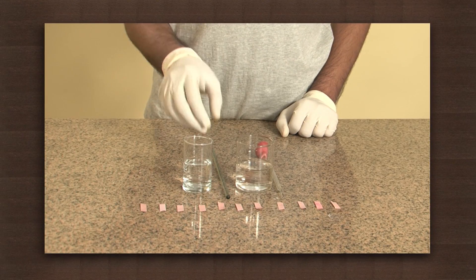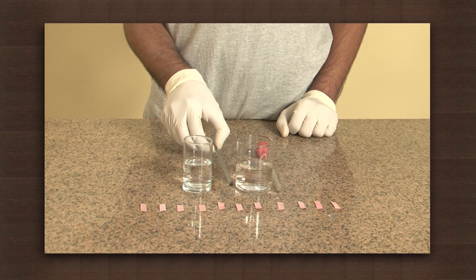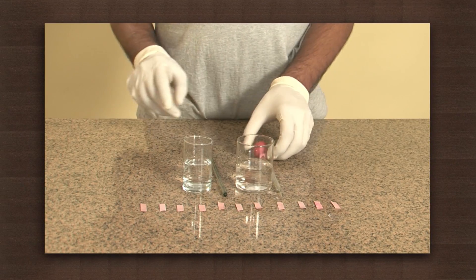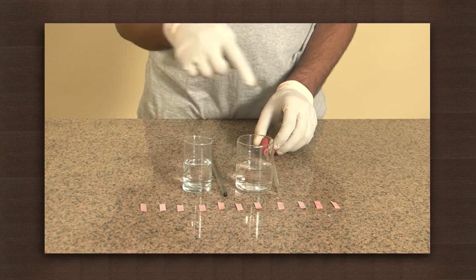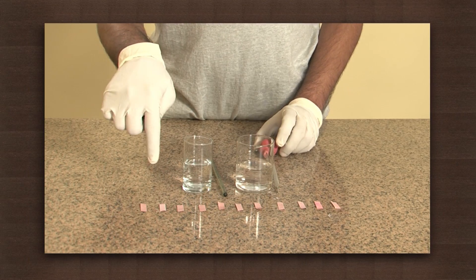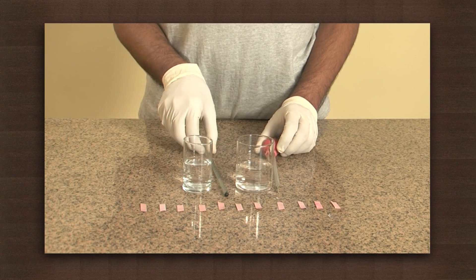Let us try an experiment to see what happens when an acid and a base react. You need hydrochloric acid, a stirrer, a dilute solution of caustic soda which is a base, a dropper, and litmus paper strips. Let's start.